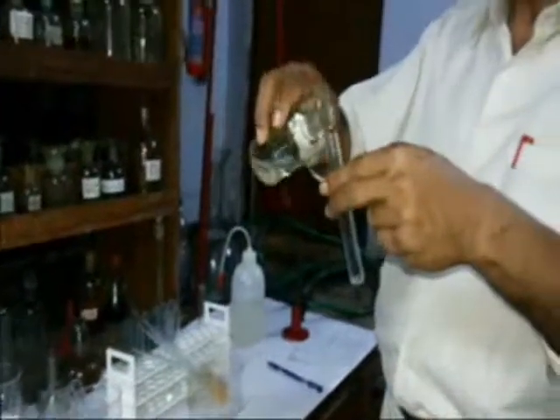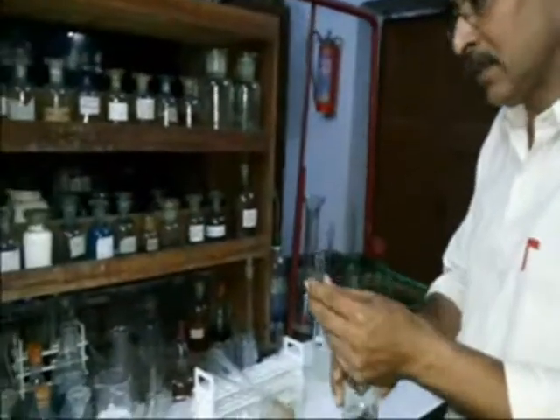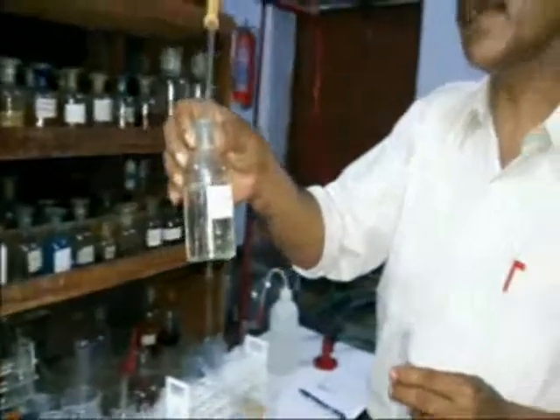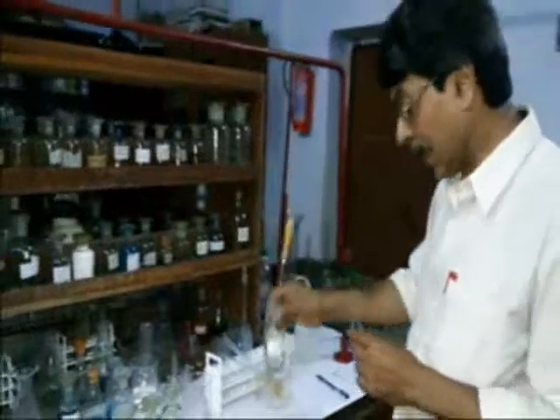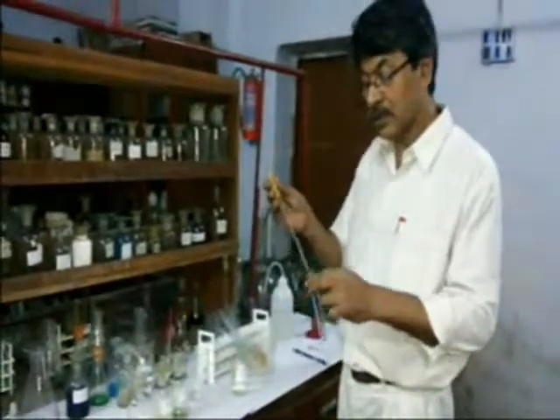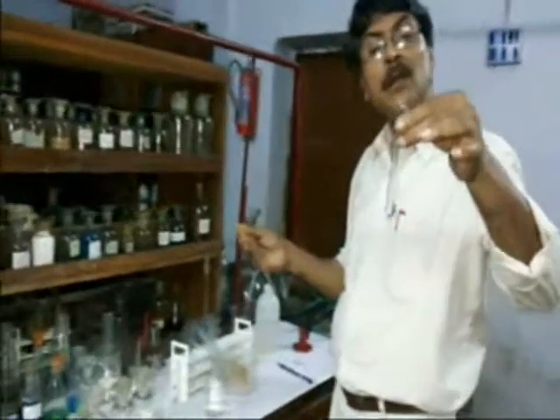The three acids are taken in three separate test tubes. First, I am taking hydrochloric acid. Aqueous barium chloride is added to it. No precipitation occurs.